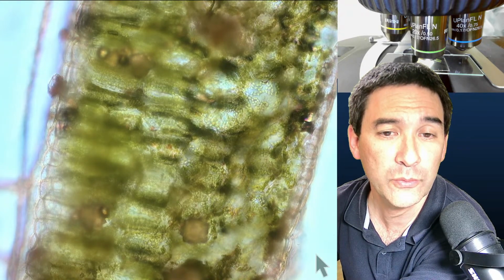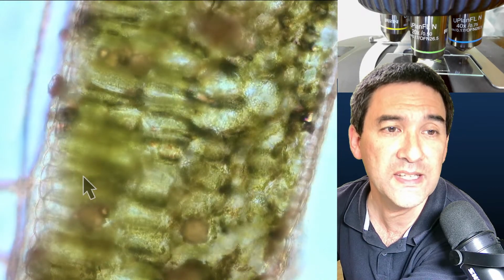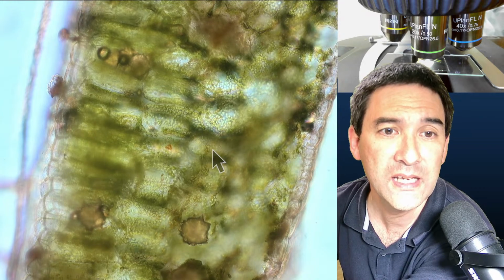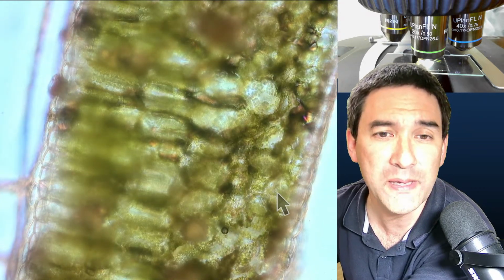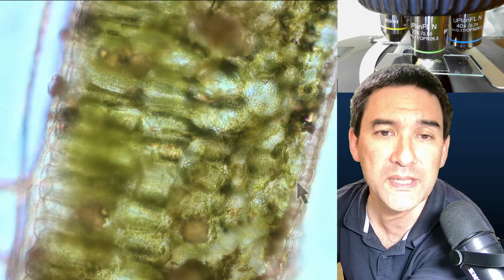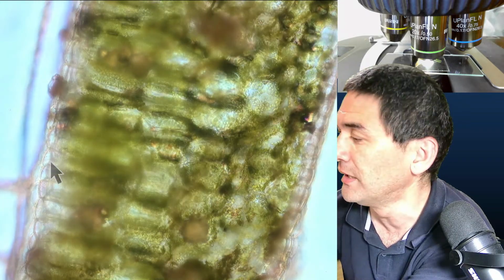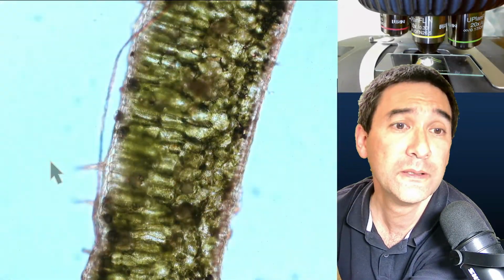I'm not going to go too much into the biology part right now, but this here is the top surface of the leaf, and you can see that the cells over here are actually long like this, and the bottom part of the leaf here, the cells are spongy, so there are air spaces in here as well, and that's basically the outer layers here, the epidermis, the upper and lower epidermis, you see, are not green because there are no chloroplasts in there. But maybe this is still a very high magnification.